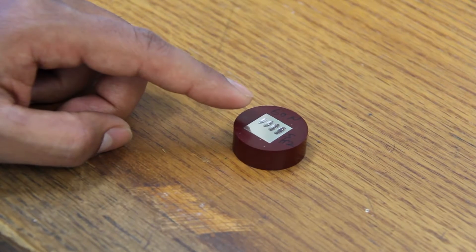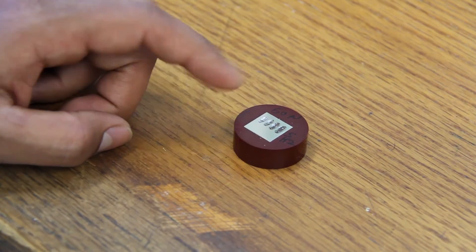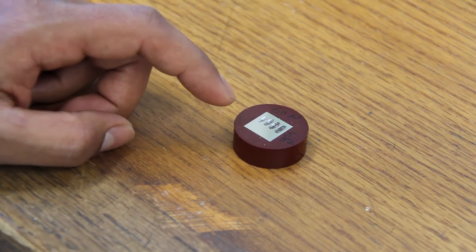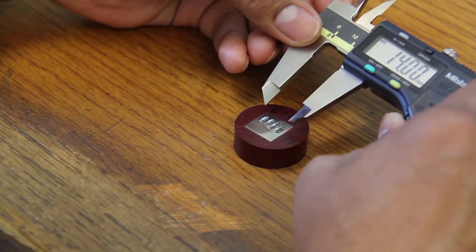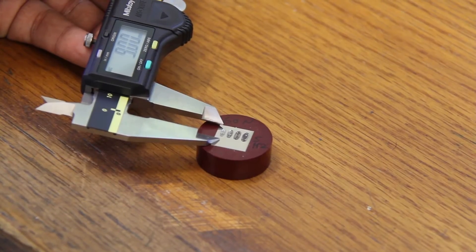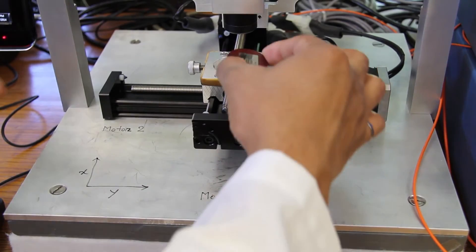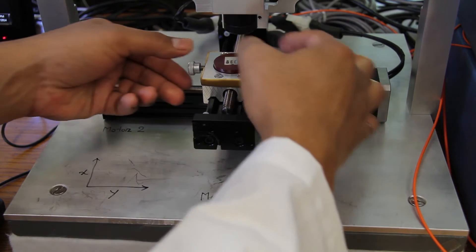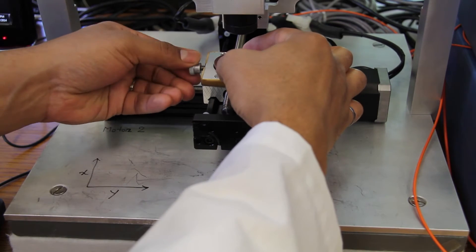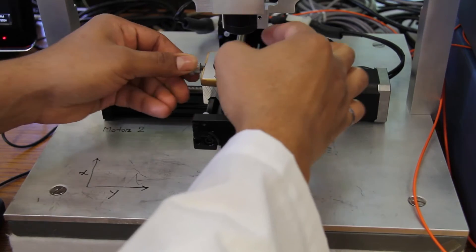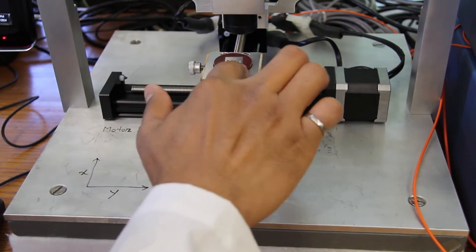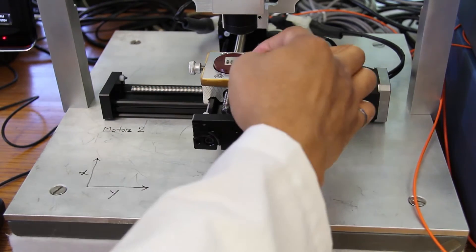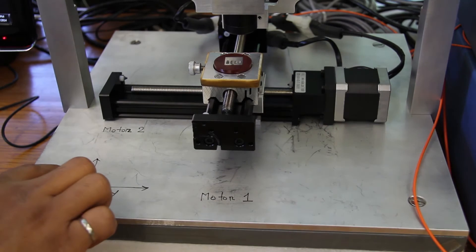We need to measure the dimension of this specimen where we want to do the optical profiling. We will scan 9 millimeters. Place your sample inside the specimen holder. Secure it with the set screw. We will scan 14 millimeters in Y direction and 9 millimeters in X direction.